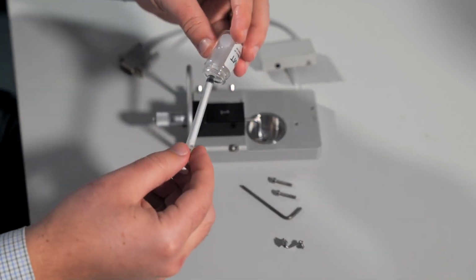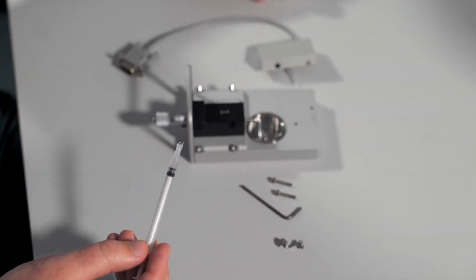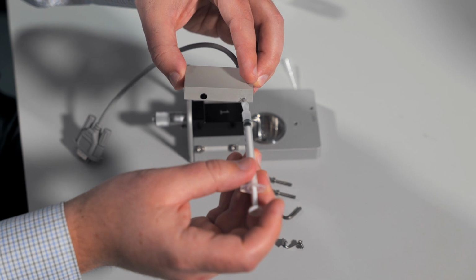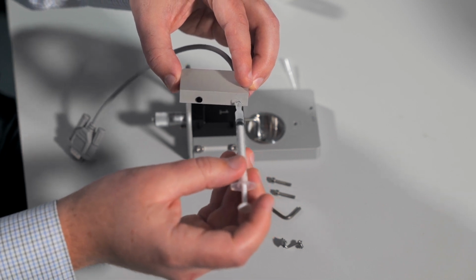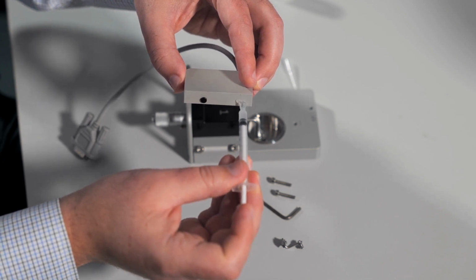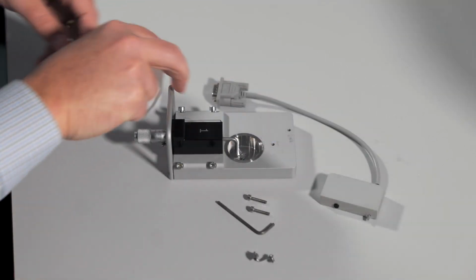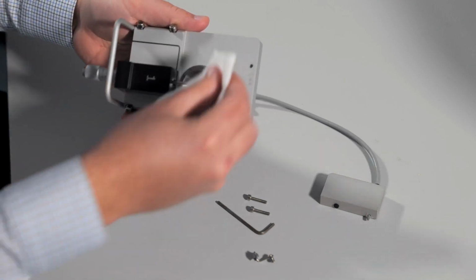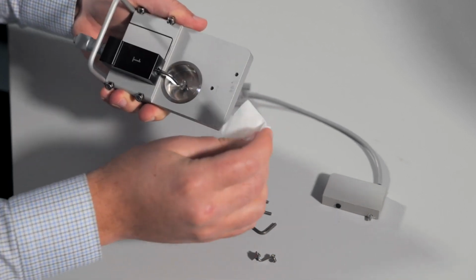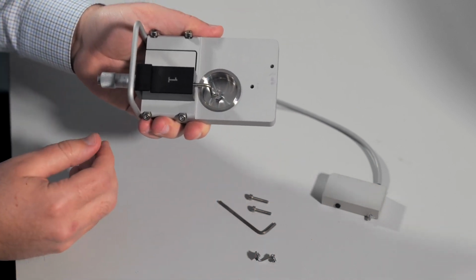Draw up some grease into the syringe tip. You can place the tip of the transducer arm into the syringe and apply some grease. You do need to be careful here so you do not damage the transducer. It's a good idea to remove any of the old grease. You can take a chem wipe and wipe that away. You can now add the transducer.